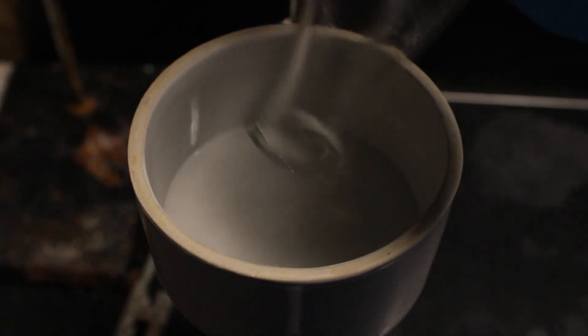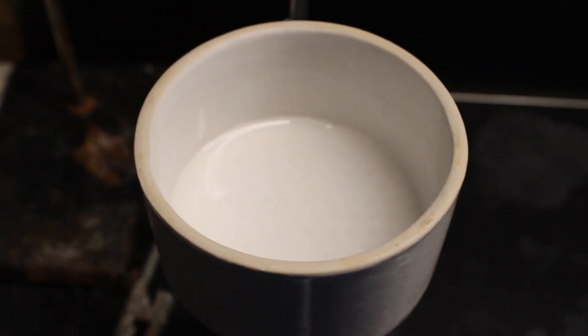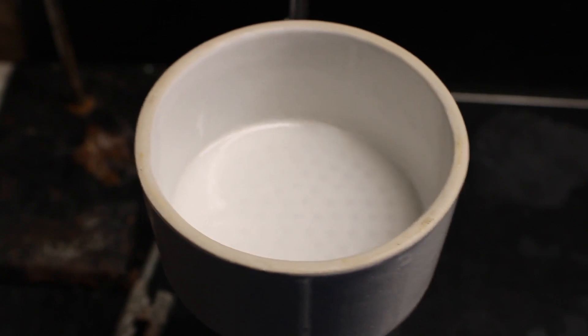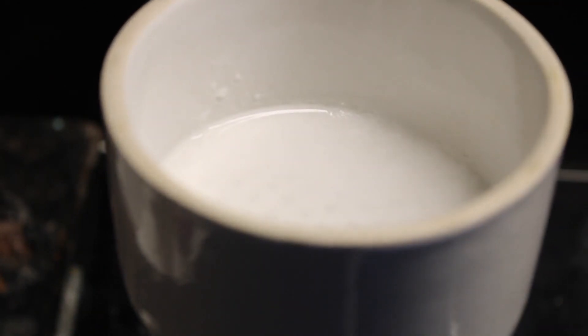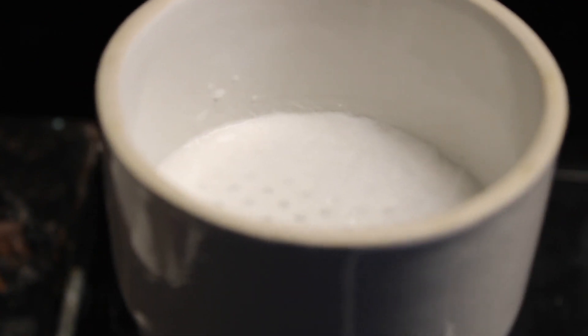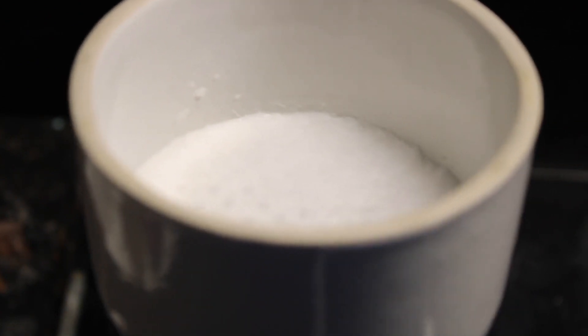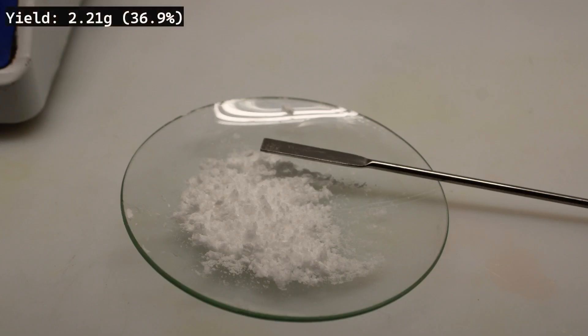The crystals that formed were filtered off and washed with ice-cold isopropanol. After drying, 2.21 grams of product were obtained, corresponding to a 36.9% yield.